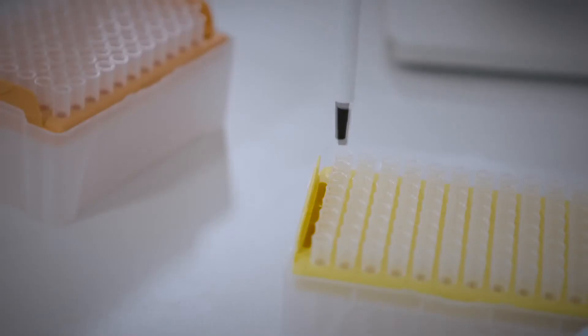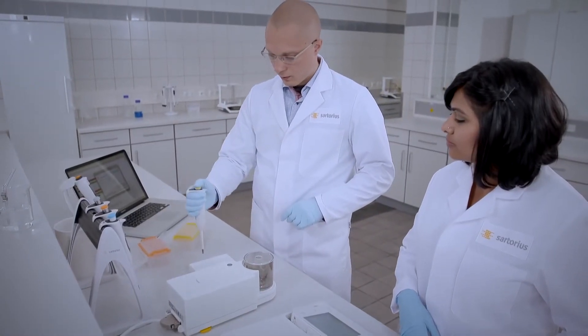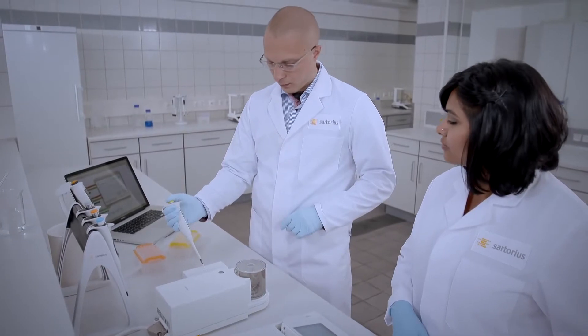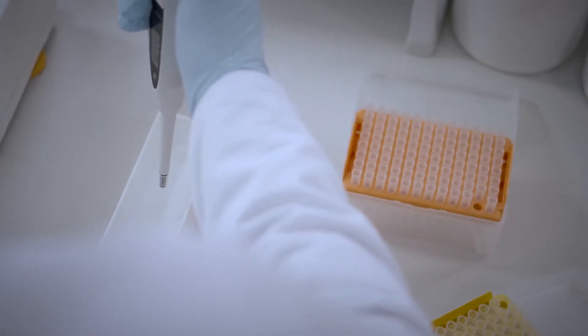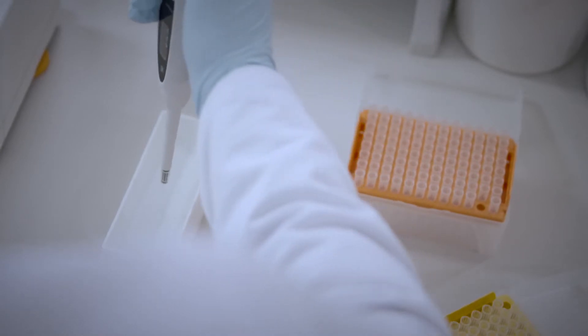When picking up tips, do not twist, only press to connect tips with pipette. It's important to maintain a stable, draft-free environment for pipette calibration with a constant temperature and humidity.